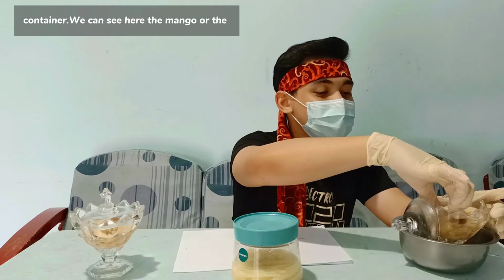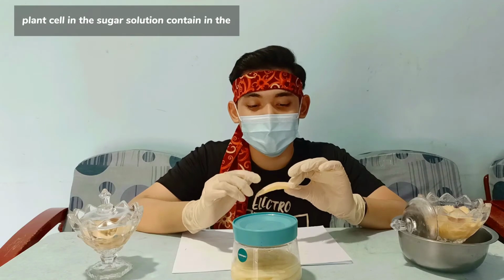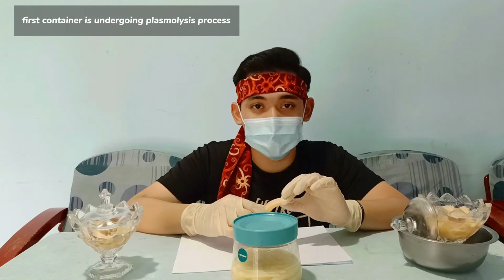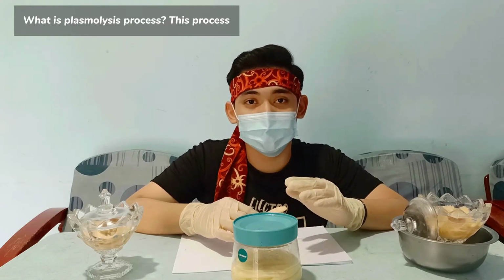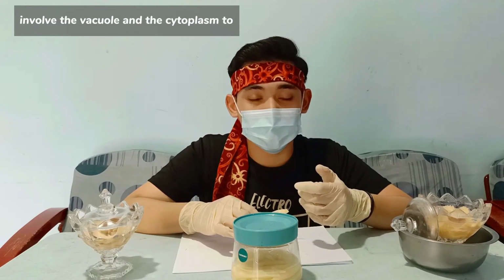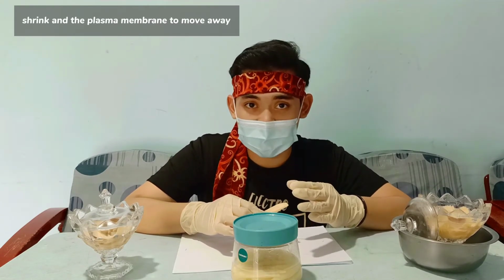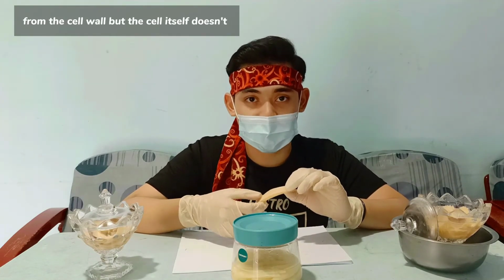We can see here the mango, or the plant cell, in the sugar solution contained in the first container is undergoing the plasmolysis process. So what is the plasmolysis process? This process involves the vacuole and the cytoplasm to shrink and the plasma membrane to move away from the cell wall.